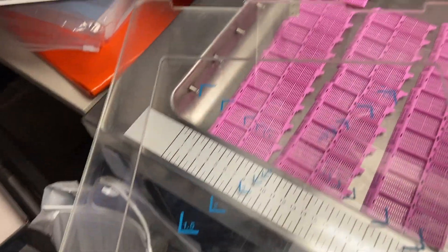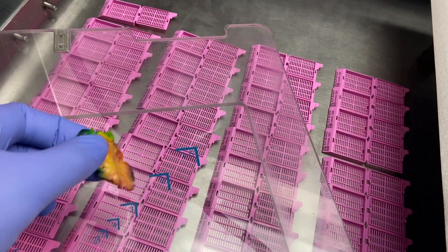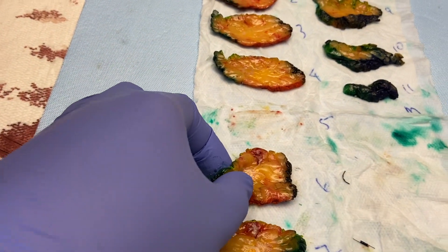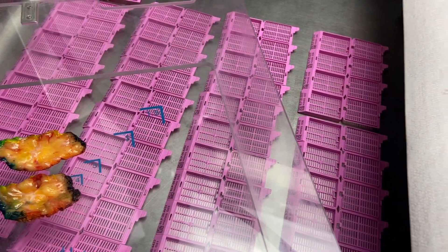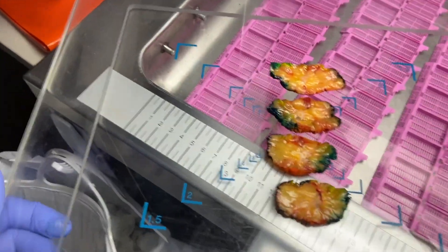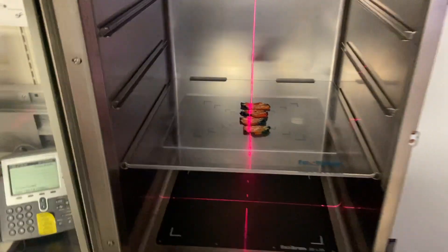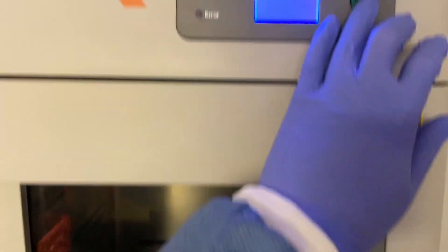I've got the grid back and I'll grab just the slices with visible tumor and lay them down from top to bottom. There's no strict procedural reason for me to do this since I've already retrieved the biopsy clip and the Savi Scout by cutting, but I'm doing it so you can see the process. I placed slices five through eight — the ones with the tumor — and I'm outside the 1.5 grid, so I'll use the 1.5 shelf in the Faxatron. Door's closed, we're ready to go.